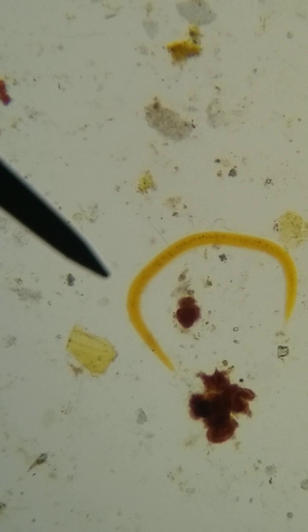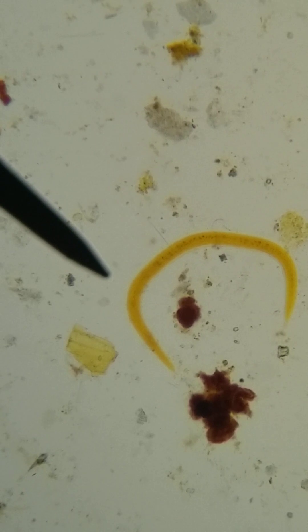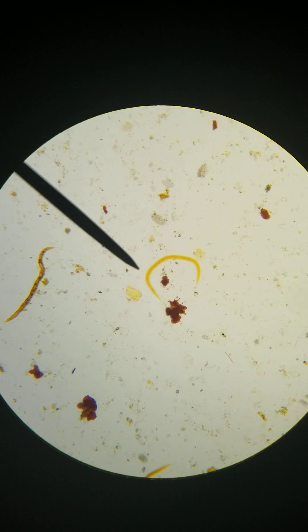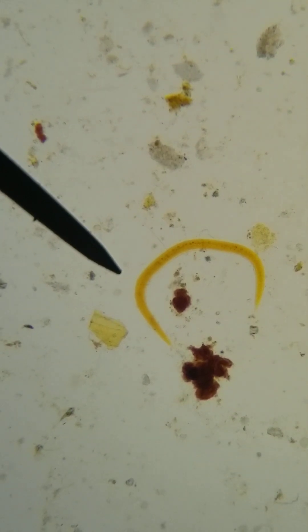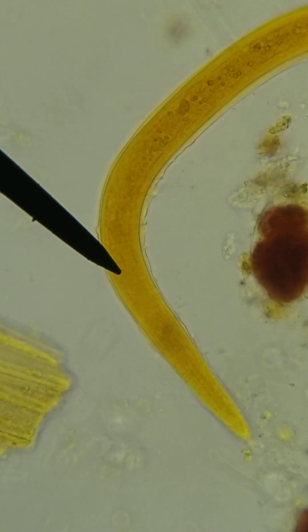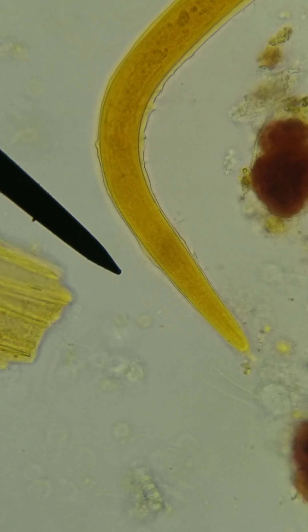This is the larvae of Strongyloides stercoralis. I'm going to put Necator americanus on here as well — which is a hookworm — so you can see the difference. So right now we are on 10x. I've zoomed in with my phone. I've got two here; we're going to focus on this one because it fits right into a beautiful line of sight on my phone. This is from a formalin-fixed specimen, so these guys are not going to move at all. This is a wet prep and I did add iodine, so that's why you get this beautiful yellowy-orange look.